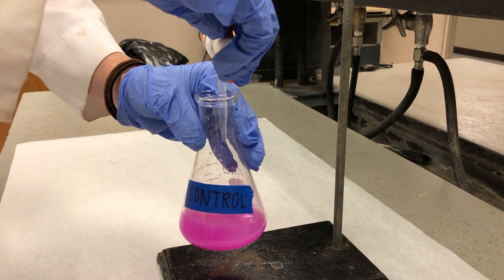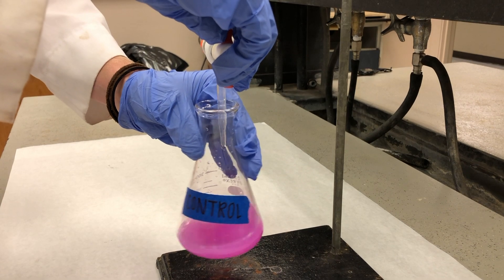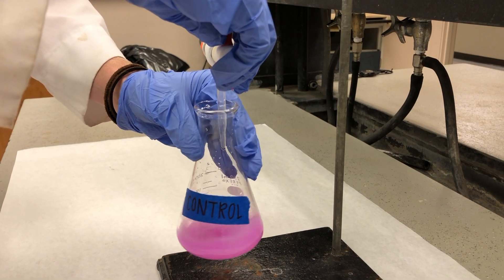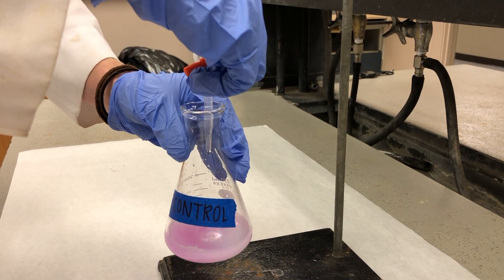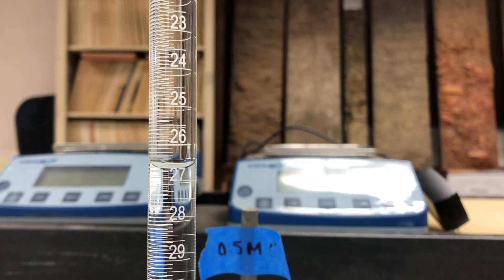Stop the dripping of the acid when the flask contents turn milky white. This signals the completion of the titration. It is important for the acid to drip slowly because this transition may be abrupt. Record the final volume in the burette to quantify how many milliliters were used, then repeat the process for each additional flask.